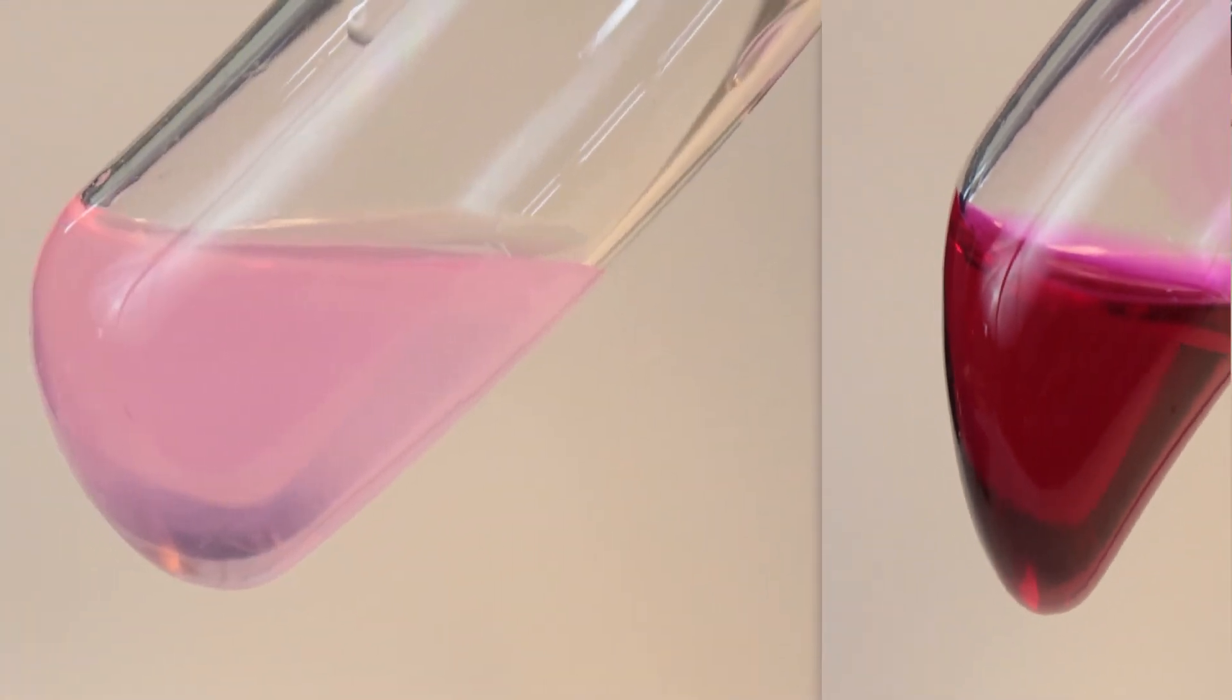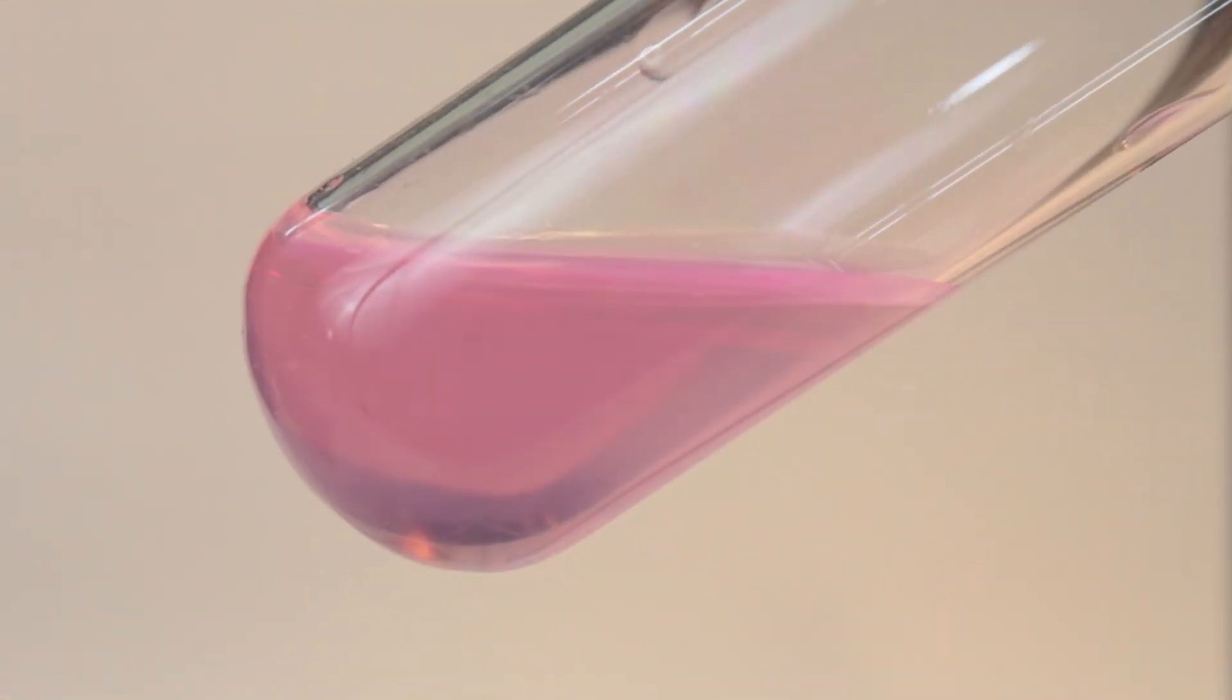So before heating it should look pale pink. After heating violet red.